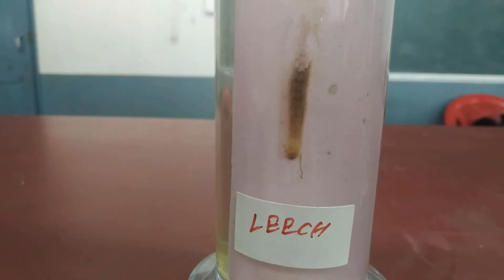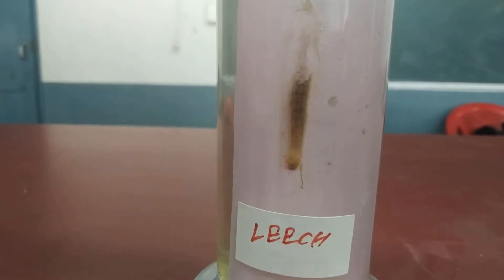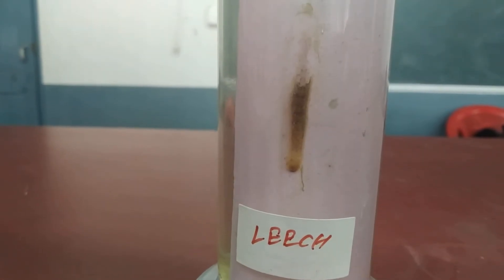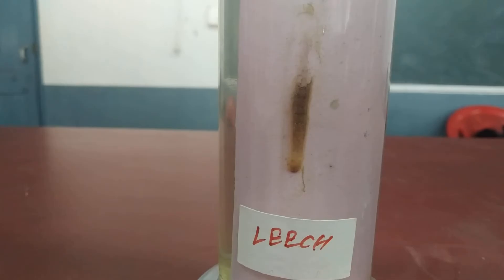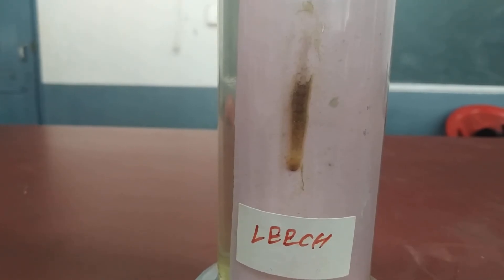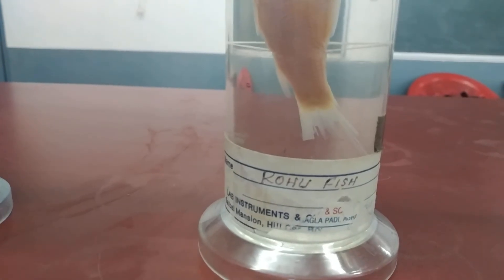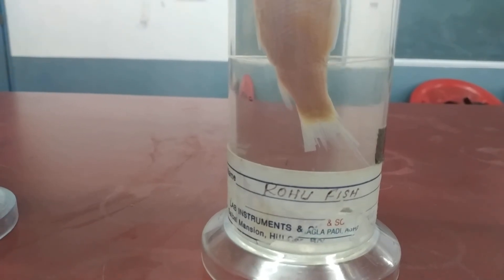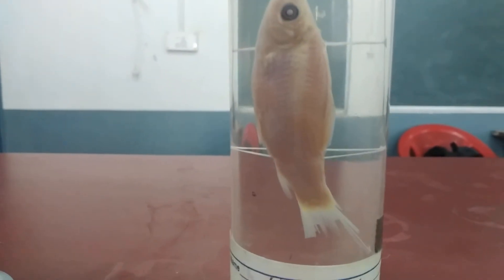The next specimen is the leech. It is also a parasite, and at the head region you will find suckers through which it attaches to the body of the host organism.